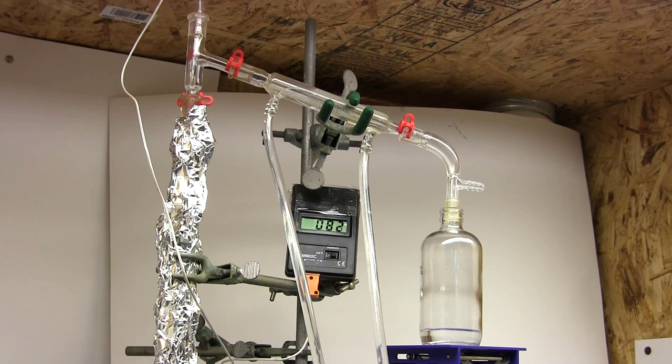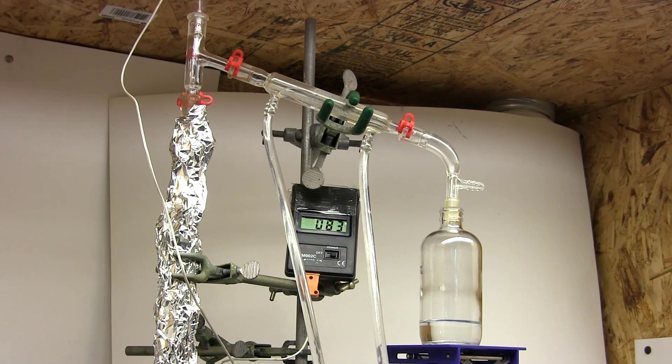Odd, our condensation temperature seems to be sticking at around 82 celsius. While we are getting good separation since it's not continuously rising, 82 does not correspond to methyl ethyl ketone. Perhaps there are other ingredients in the lacquer thinner or other azeotropes I'm not aware of. Maybe I'm still overloading the column but only very slightly. Oh well, I'll keep going. Maybe I can still get some good toluene separation.